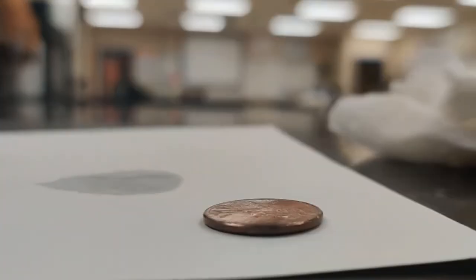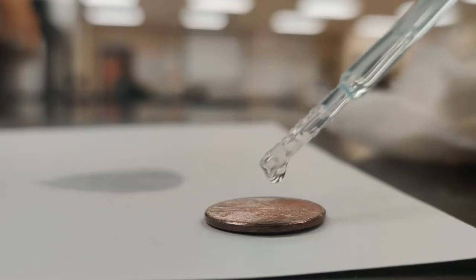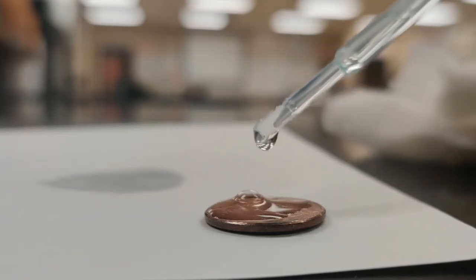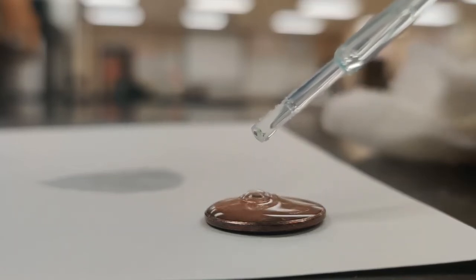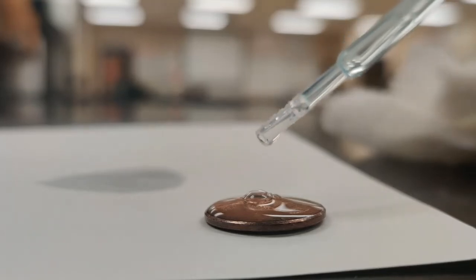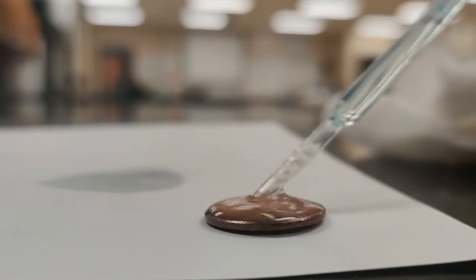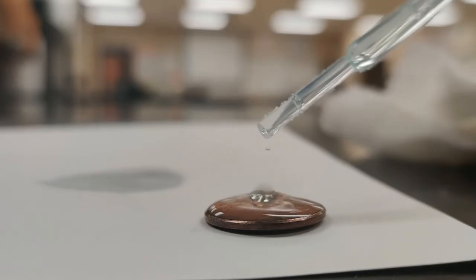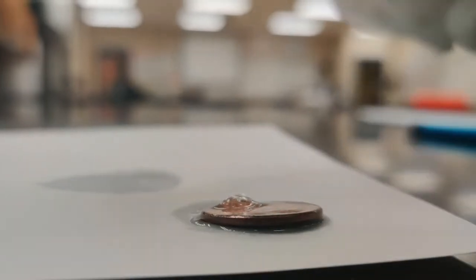So let's do trial 3 now. A nice fresh pipette of water. So we've got 1, 2, 3, 4, 5, 6, 7, 8. I got an air bubble here, so I'm trying to see if I can break up that suds. 9, 10, 11. Wow, okay, so still a much lower number. Only 11 drops that time.